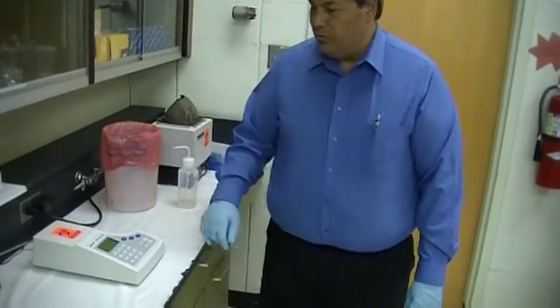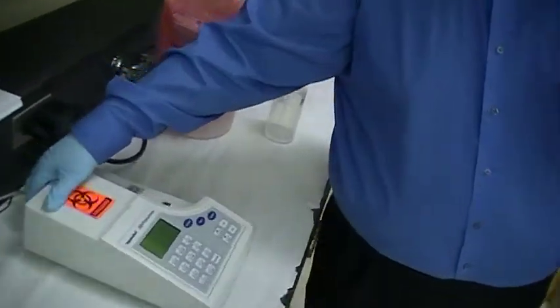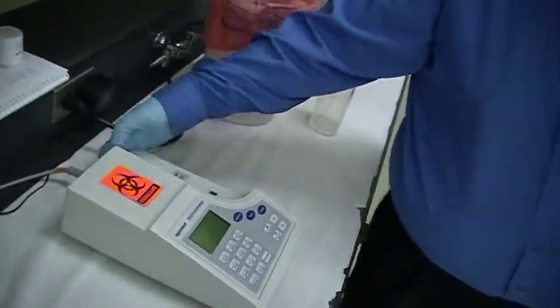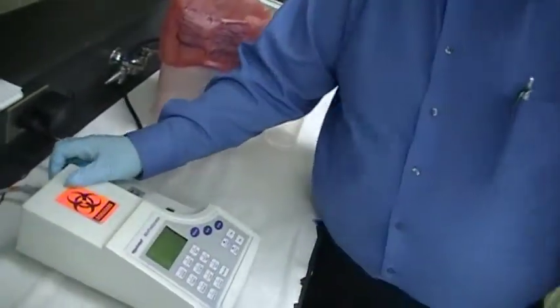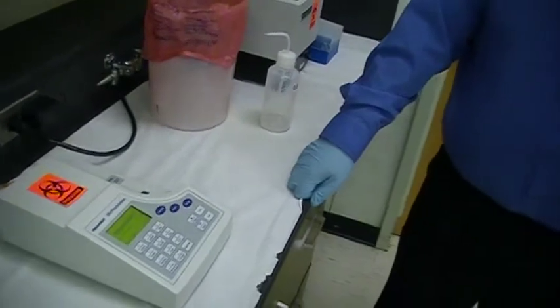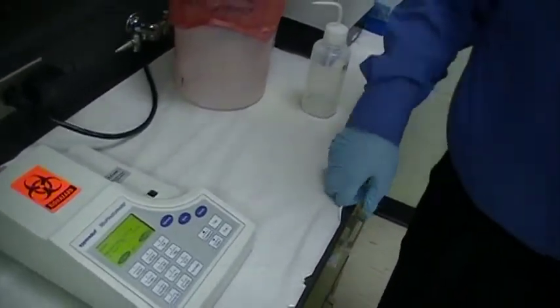So the first thing you do is you come and reach behind it and there is a switch where you actually turn it on, right here. So you turn it on and you should let it warm up for five to ten minutes.